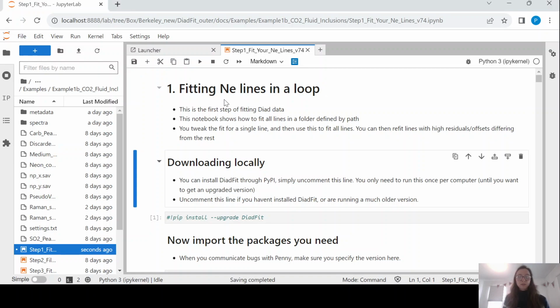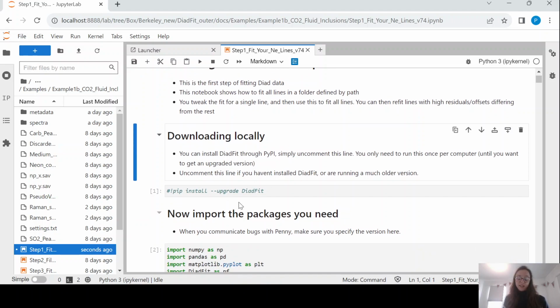So as normal, you are going to want to pip install DiadFit if you haven't done so already. And the way that I have structured this data is you are basically going to make sure that... So we are working in this example, so you can download this entire example off GitHub if you want to. This is example 1B. The spectra from the WITEC is in one folder and the metadata is in another.